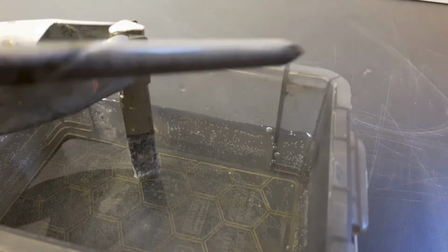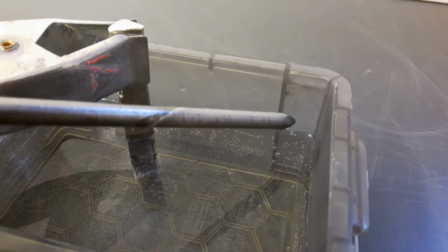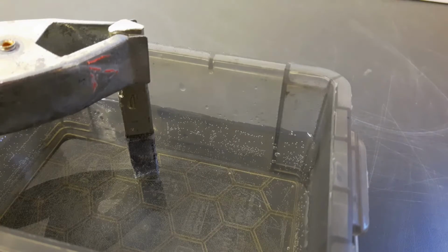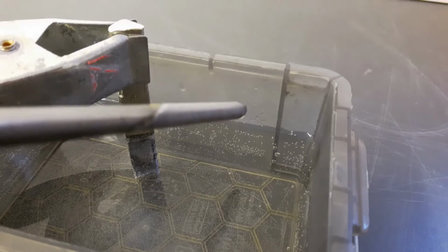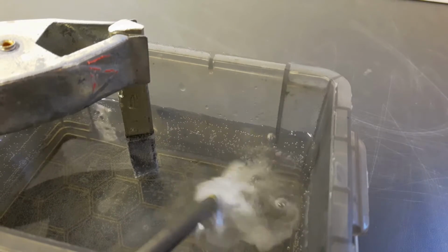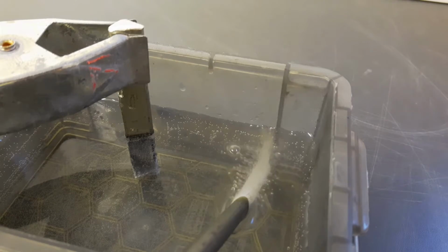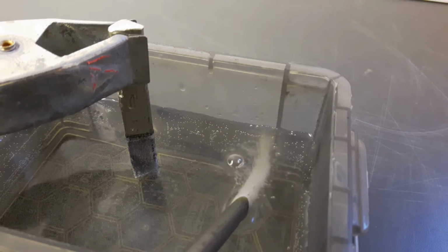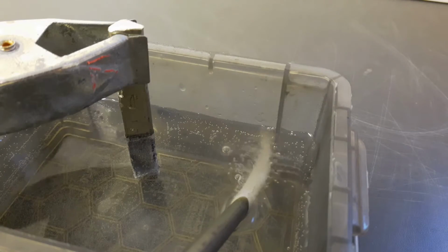If you now think, wait, there is still hydrogen produced, so why are you frustrated? You will be left with the stannous chloride as well. Yes, that's true. So maybe we are double lucky and get pure tin and stannous chloride solution. So this is pretty much something that should not occur in theory, because we're reducing two elements at the same time. Let me show. I pull this out here, and this is definitely coated with tin at the moment. Oh, camera, you can't see that well. But I can tell you, this is plated with tin.